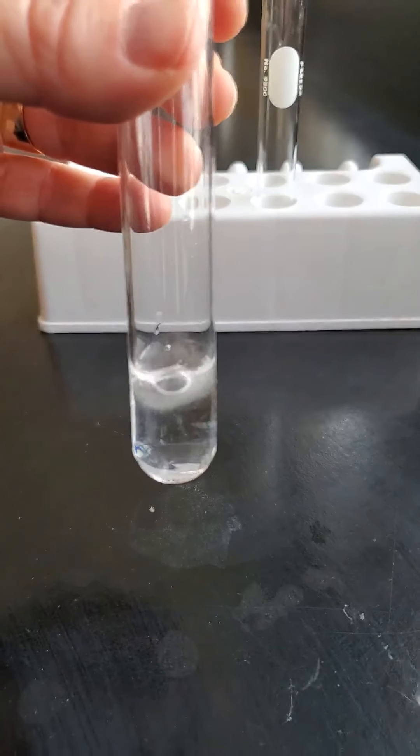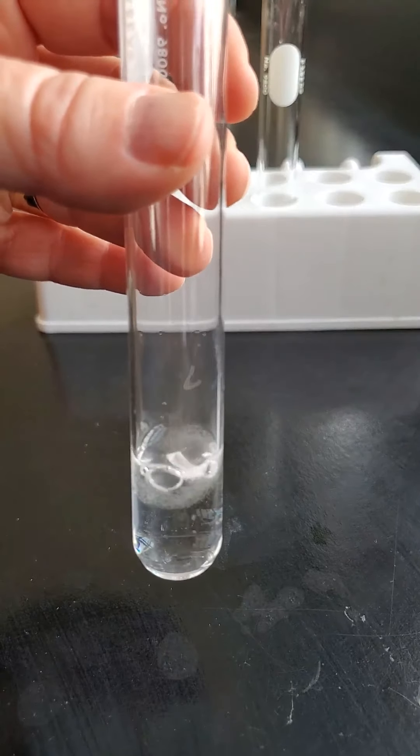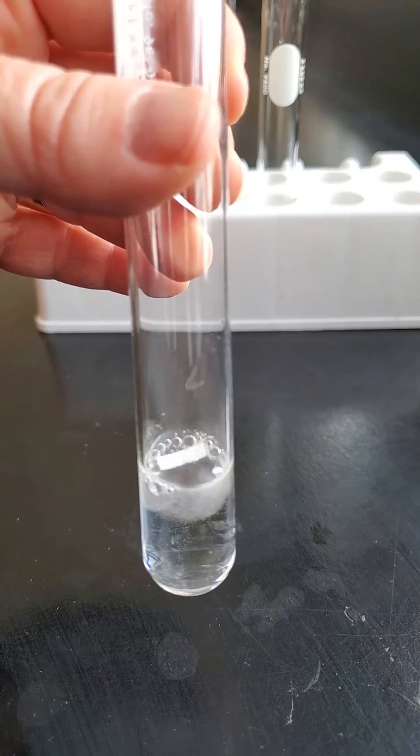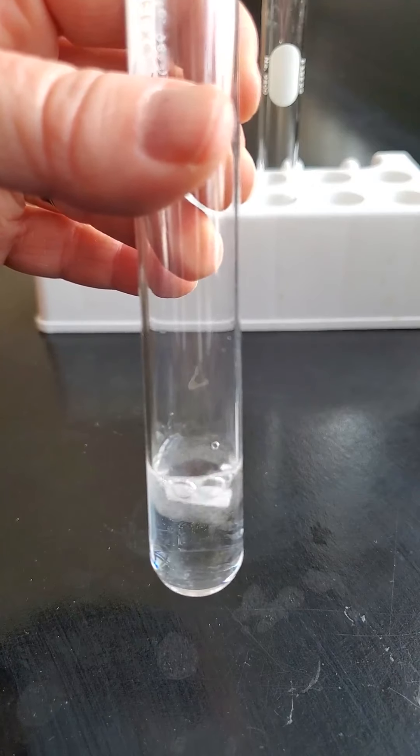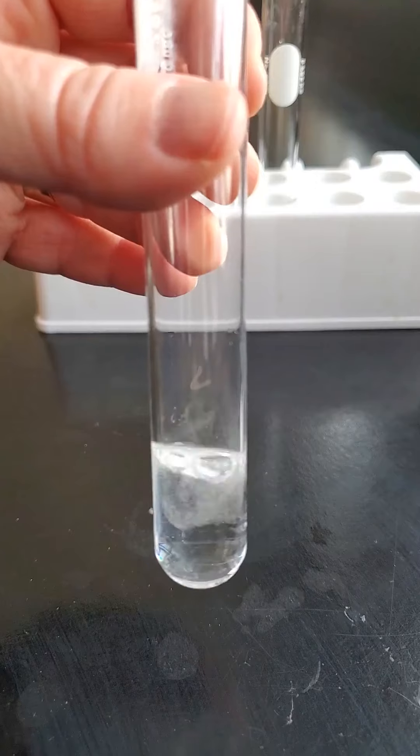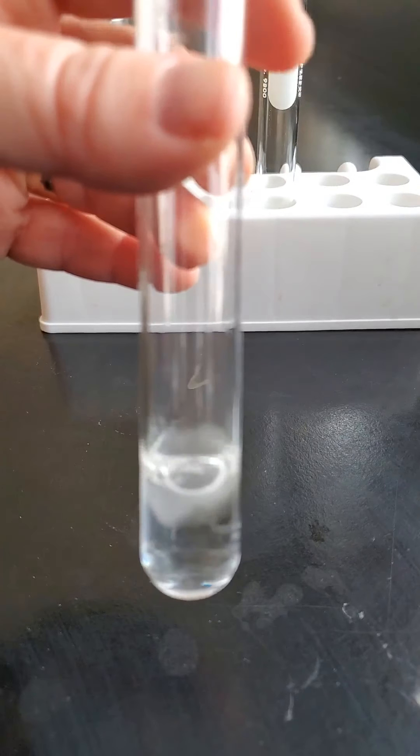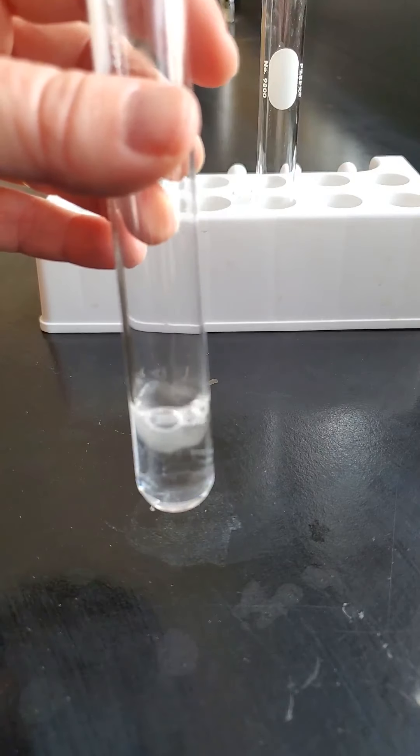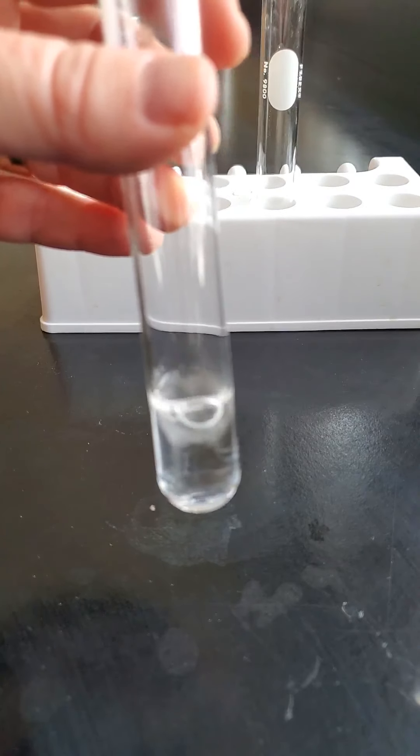You might even be able to see that little bit of smoke. There's a little puff of smoke. If I put it on the black background you can see little puffs of smoke happening. You know this reaction is hot - it's an exothermic reaction producing heat and bubbling away like crazy.